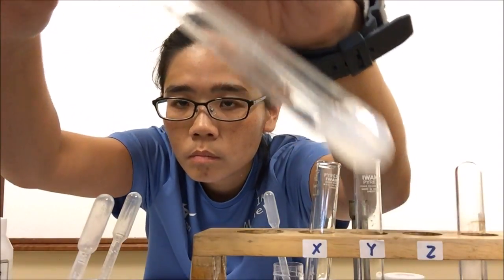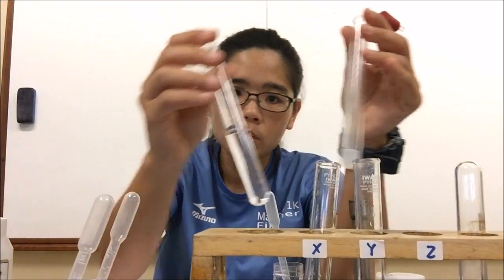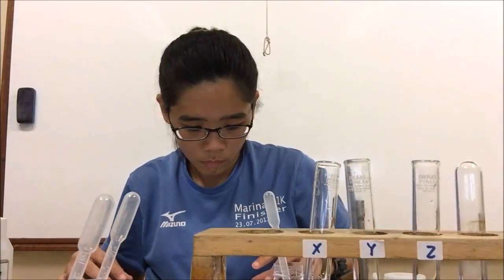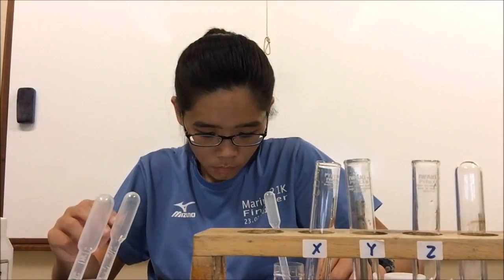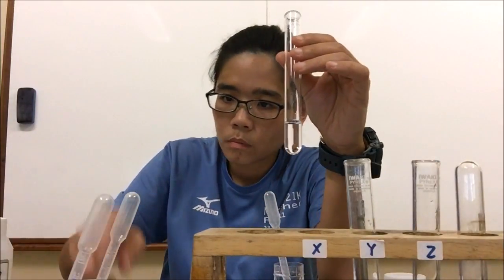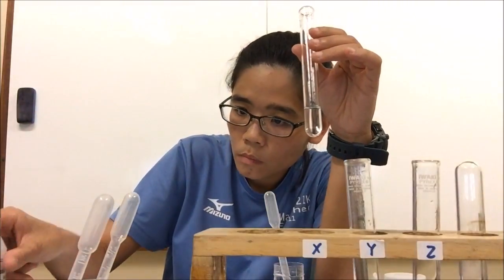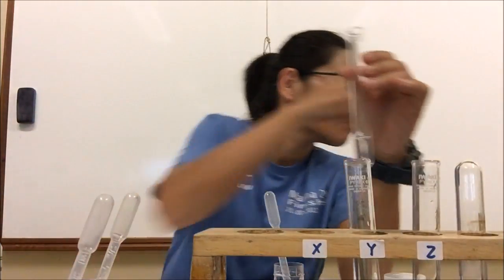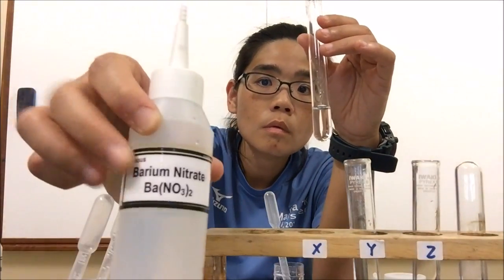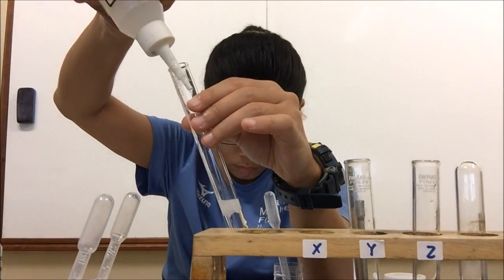We go on to the next part. We pick up the test tube containing solution X and add barium nitrate. Barium nitrate is the test for sulfate — we are on the lookout for a white precipitate. We shake to mix well and we do get a white precipitate, indicating that X contains sulfate.